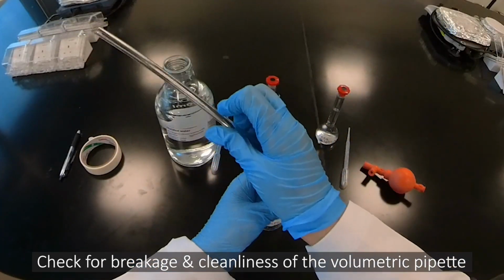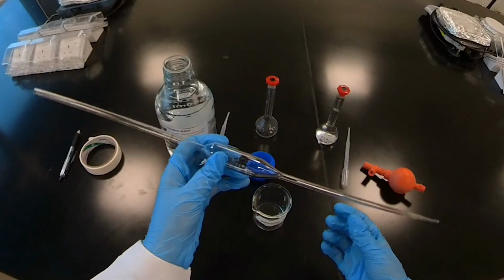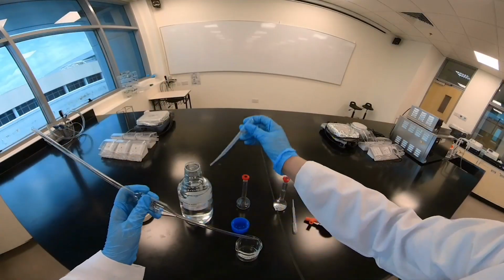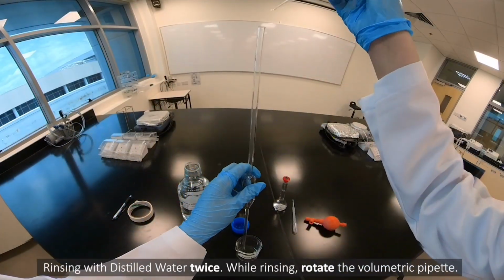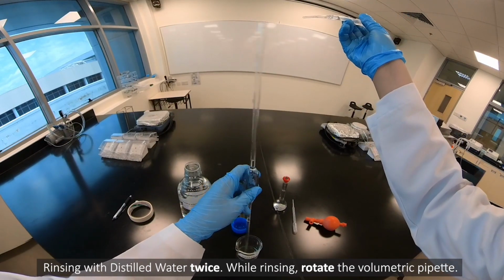Check for breakage and cleanliness of the volumetric pipette. Rinsing with distilled water twice. While rinsing, rotate the volumetric pipette.